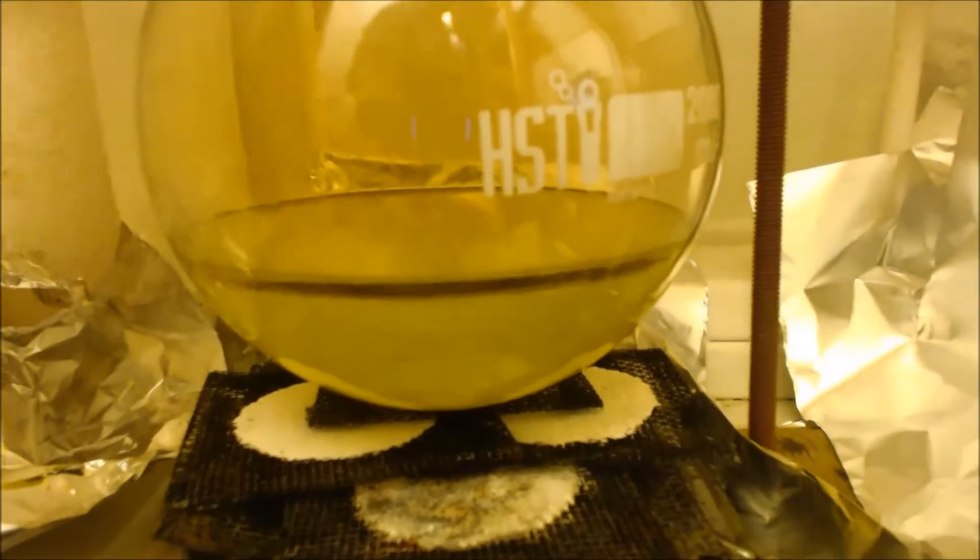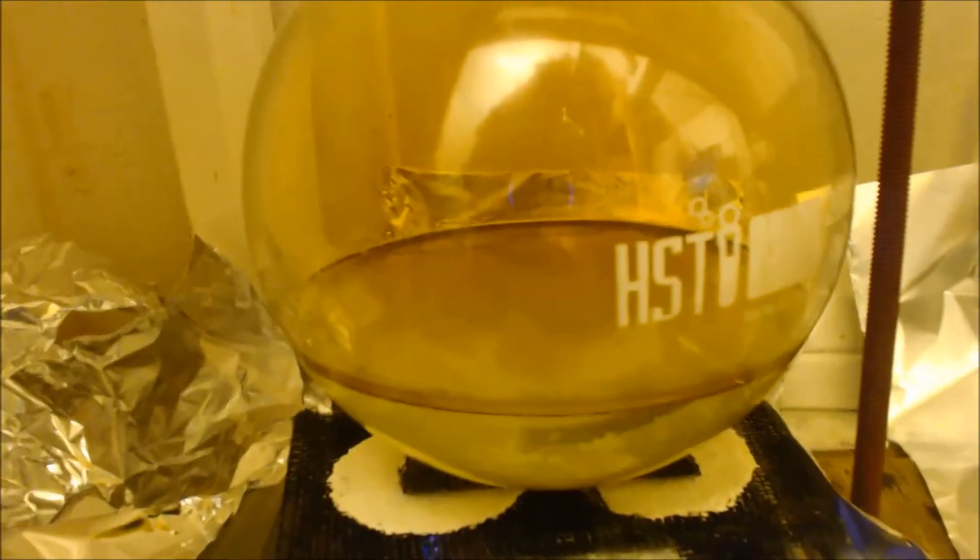Alright, this is the next day. I only really refluxed it for two hours yesterday. As you can see, what's that down at the bottom there? Some kind of solid. I'm hoping that's my product. And you can see up on top, that stuff floating on top a little bit from surface tension. You can clearly see there's some kind of solids at the bottom. There were no solids before. As you can see, I just started to heat up a little bit. And I already got gas on here. Nitrogen oxides up to here.